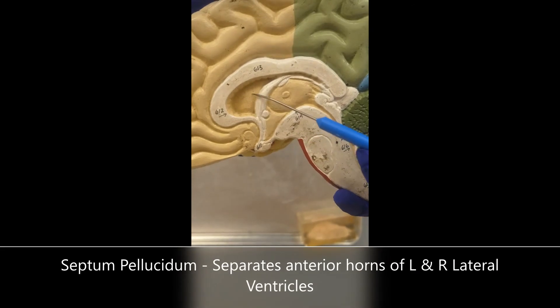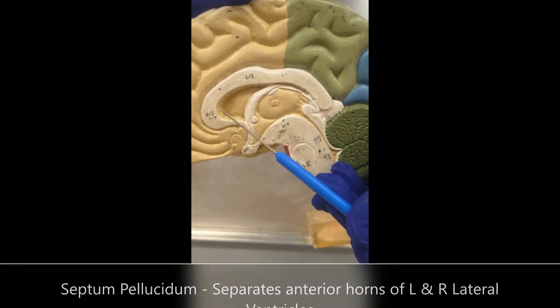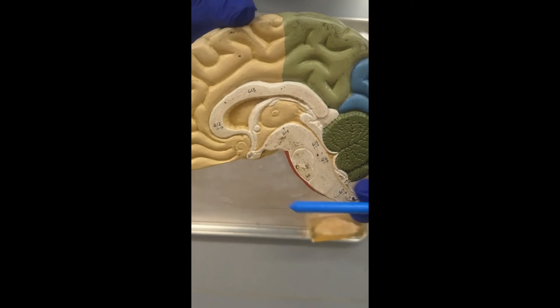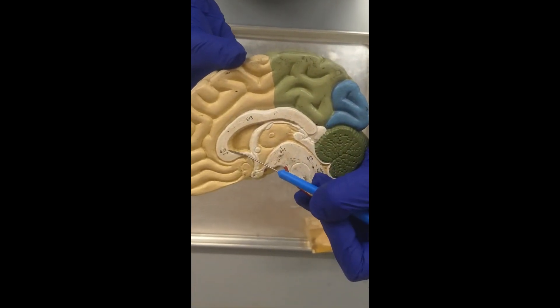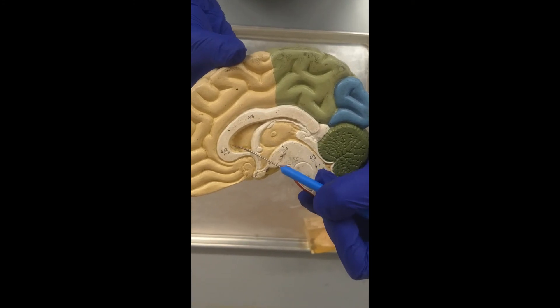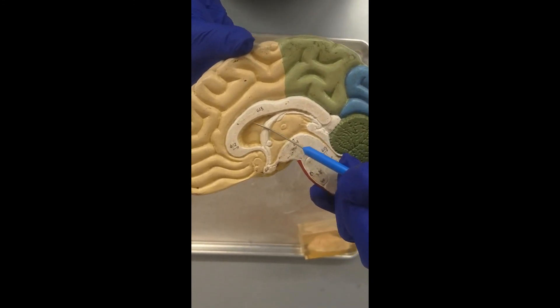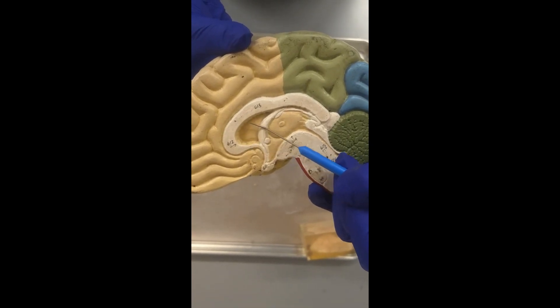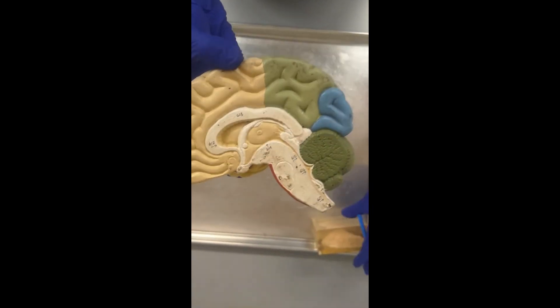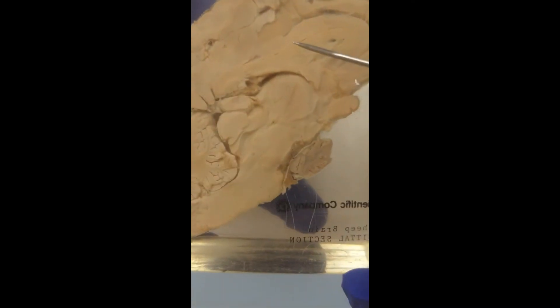The septum pellucidum — think of like a septum piercing, the septum in between your nose, the thing that gives you two holes. So septum like a divider. There's going to be a very thin little dividing membrane in between this section right here, and we call this the septum pellucidum. I actually have it on our sheep brain model right here.